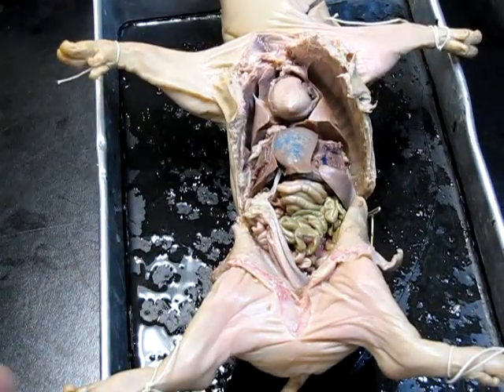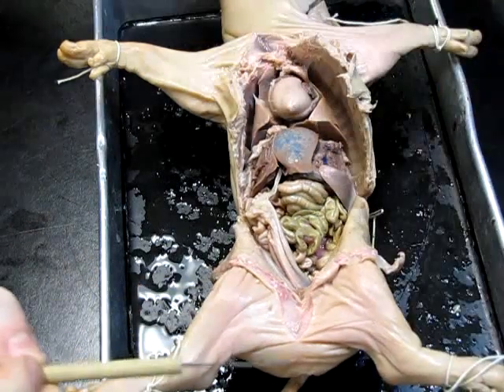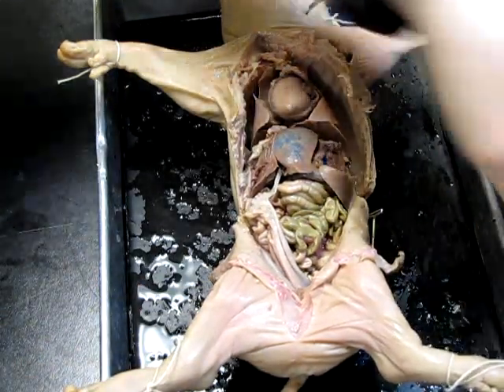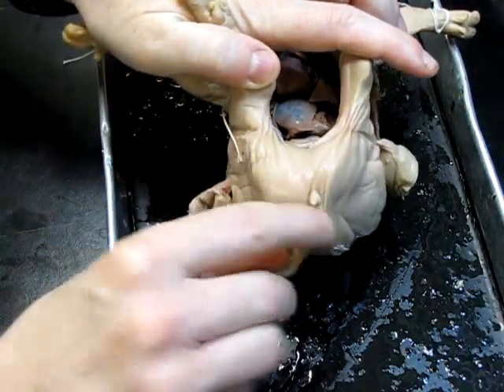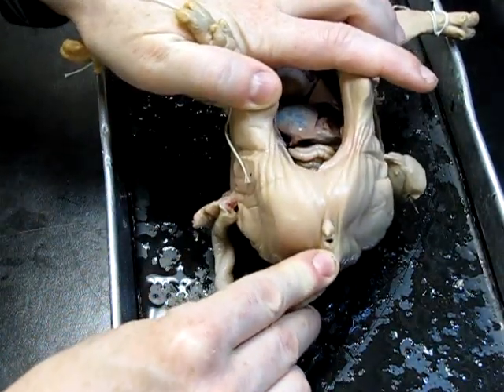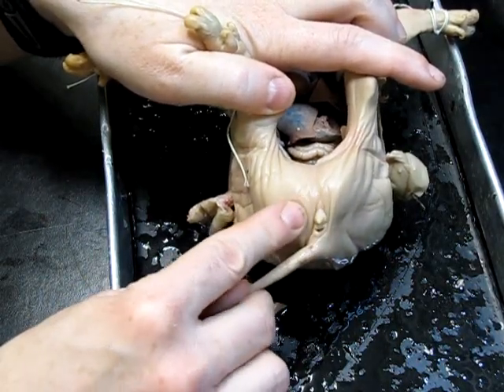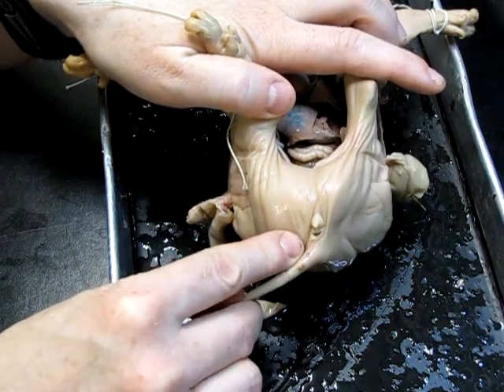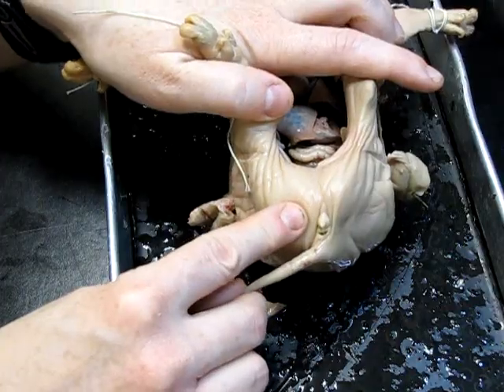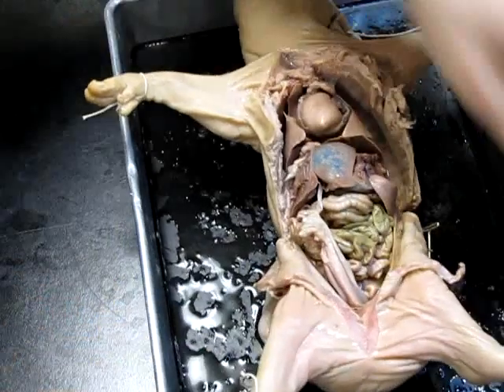Pretty much identical, except I haven't bothered to cut down into the groin area because, looking at the external genitals, I was able to discern that this was a female. Here we can see the opening for the anus, but above that we clearly have external female genitalia — there's actually the opening to the vaginal canal above that. Just from external genitalia we can tell that this is a female animal. Let's look for the internal structures representative of the female pig.